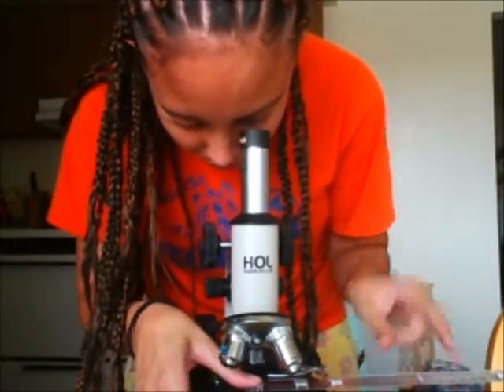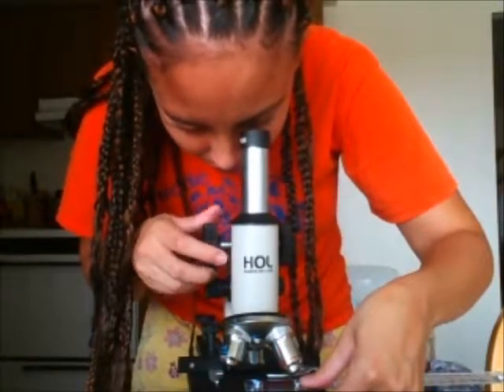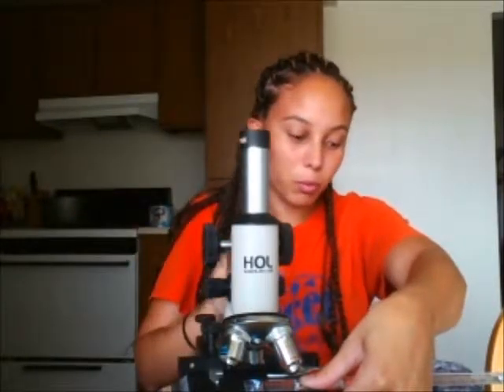So I'm going to go ahead and do that. I just need to focus it a little. I see the line, so I'm going to focus it using both of my knobs, and I'm getting for the lowest power 2 millimeters, and I will go ahead and insert that into my lab assistant, and I'm going to continue to do the same for each of the other powers. So now that I have all my fields of view completed, my next step would be to calculate the actual field of view with the formula given on our instructions here.